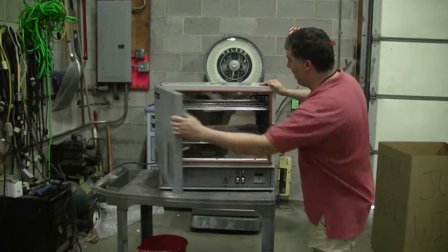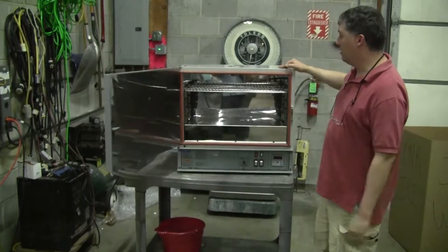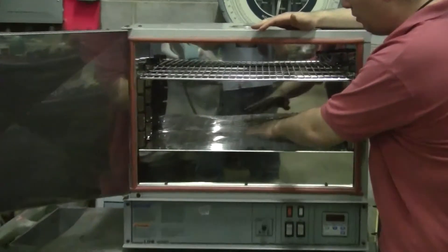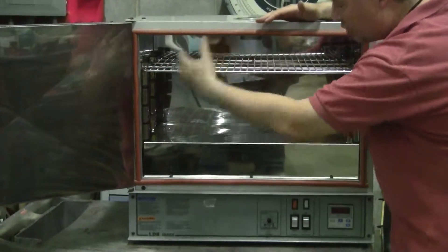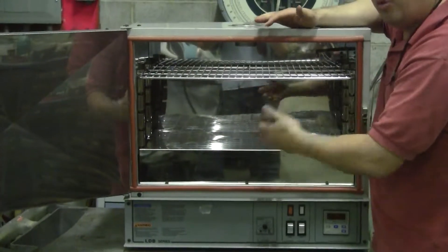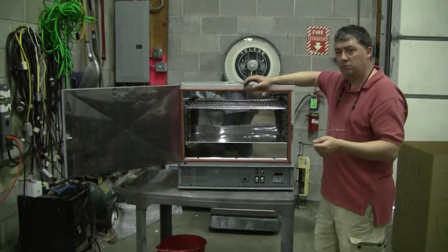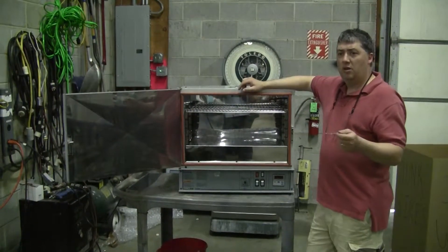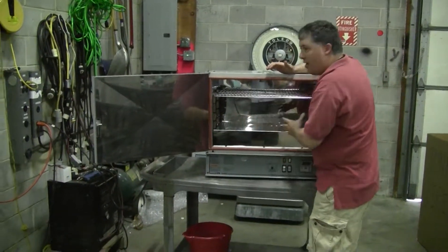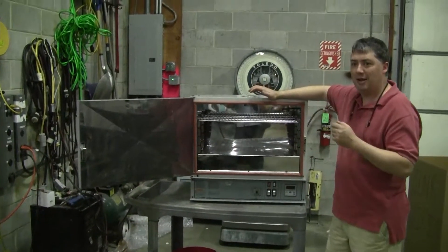Mechanical convection — that's what this particular oven is — is when there is a fan or blower that is going to recirculate the air. What that does is it gets better heat transfer, thereby keeping the entire chamber at a steadier, constant temperature.